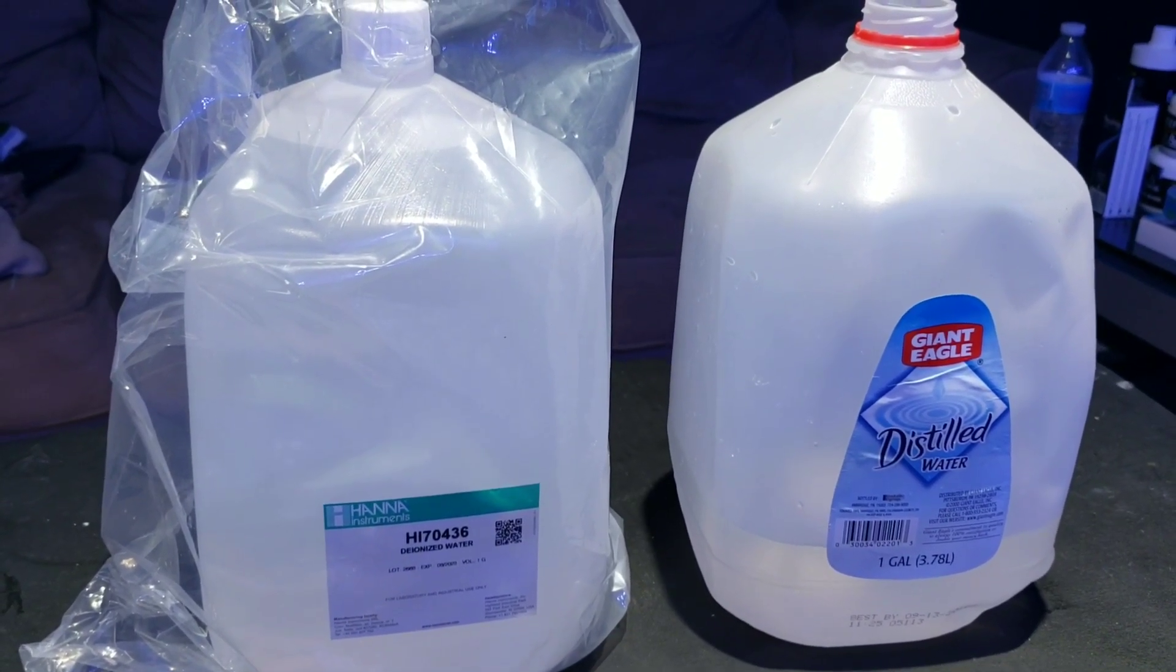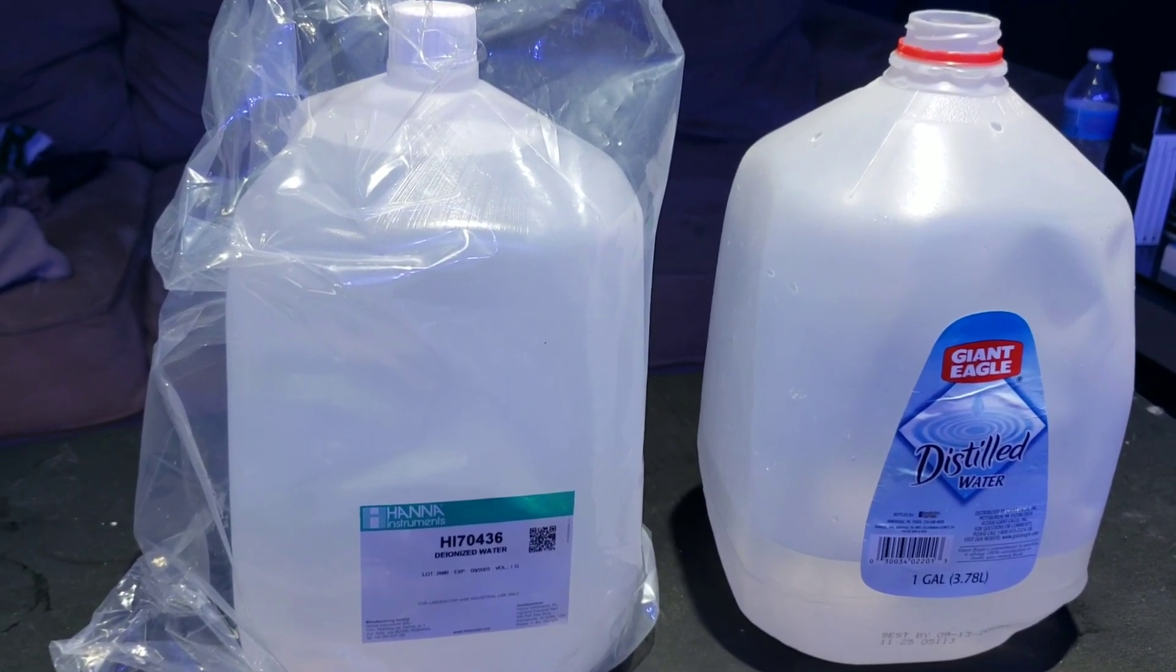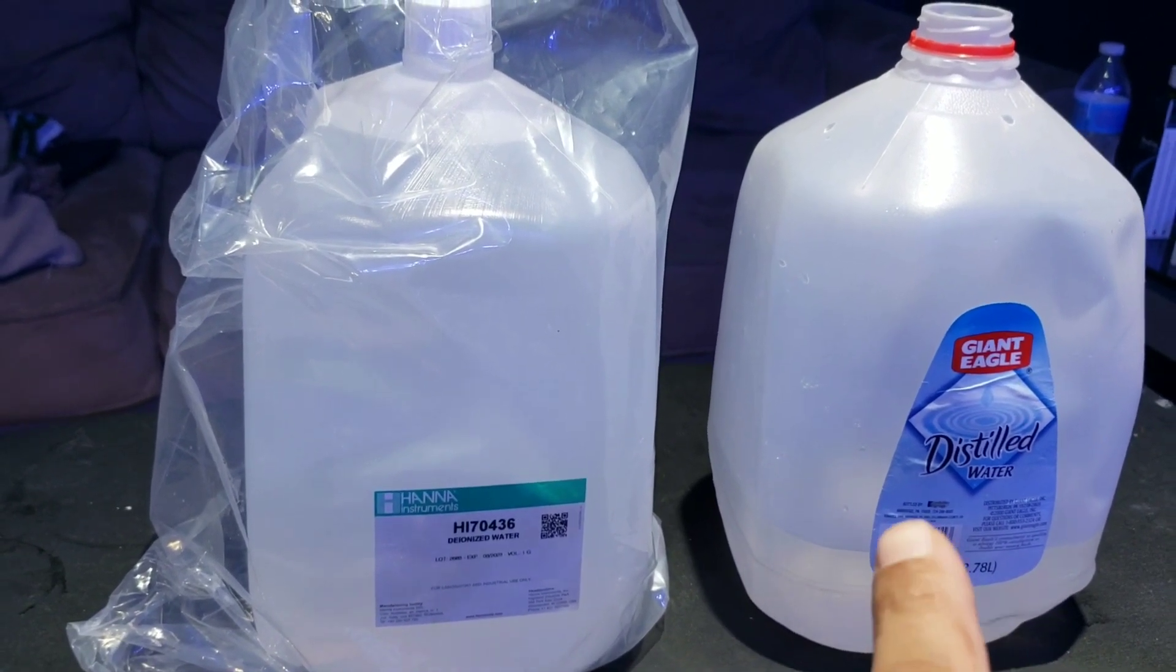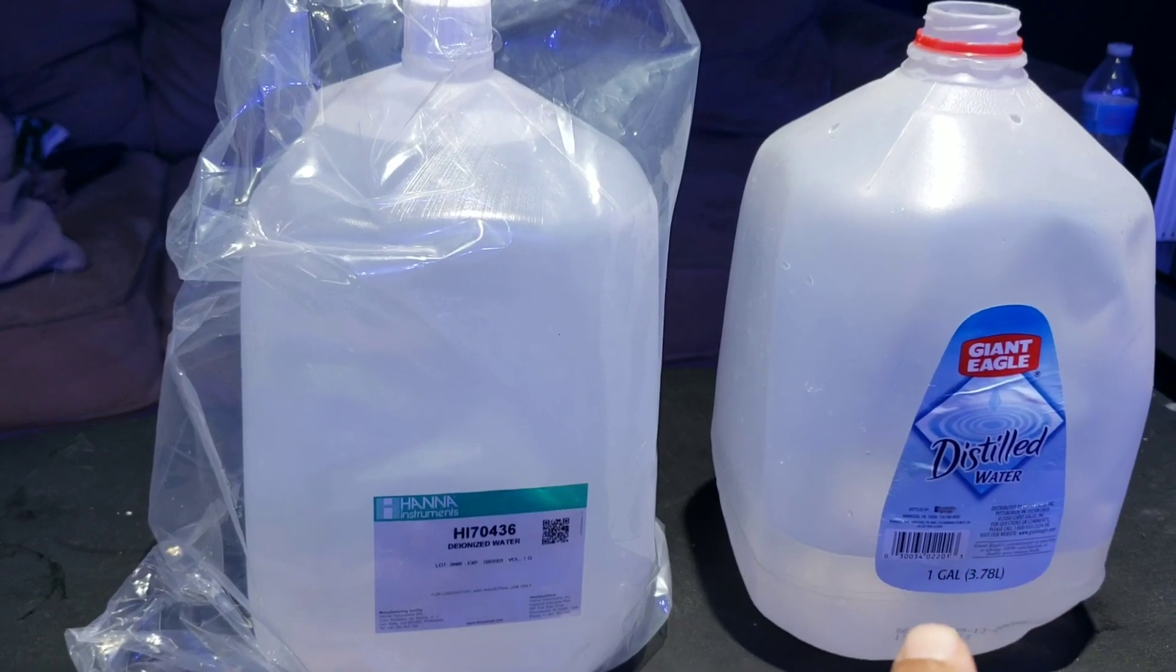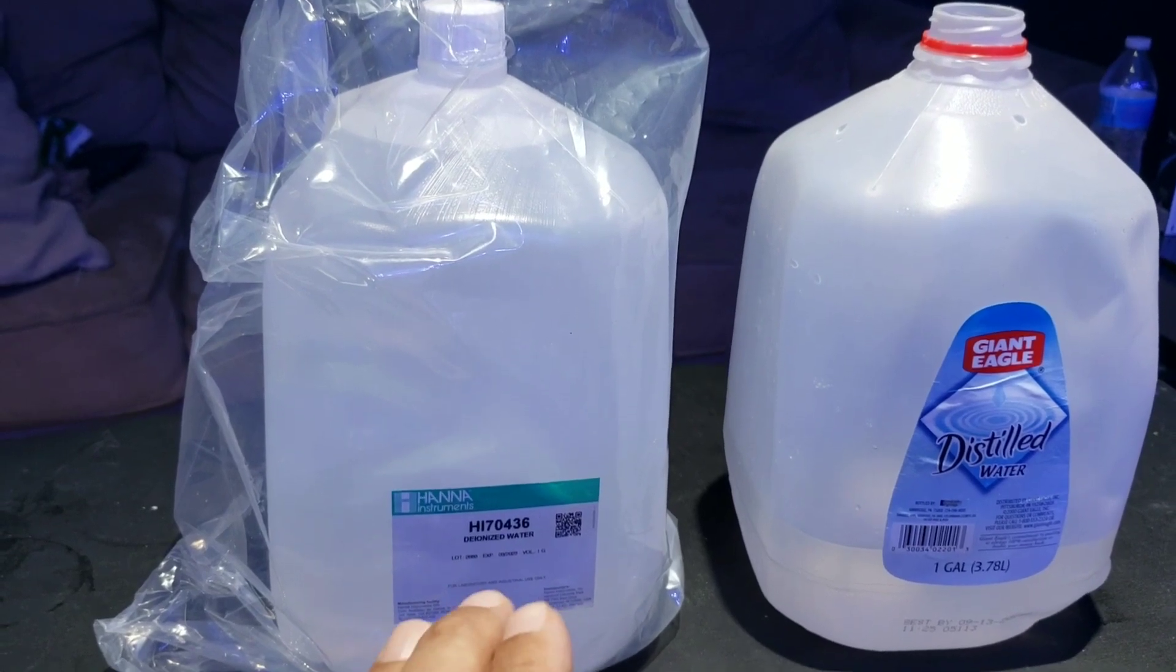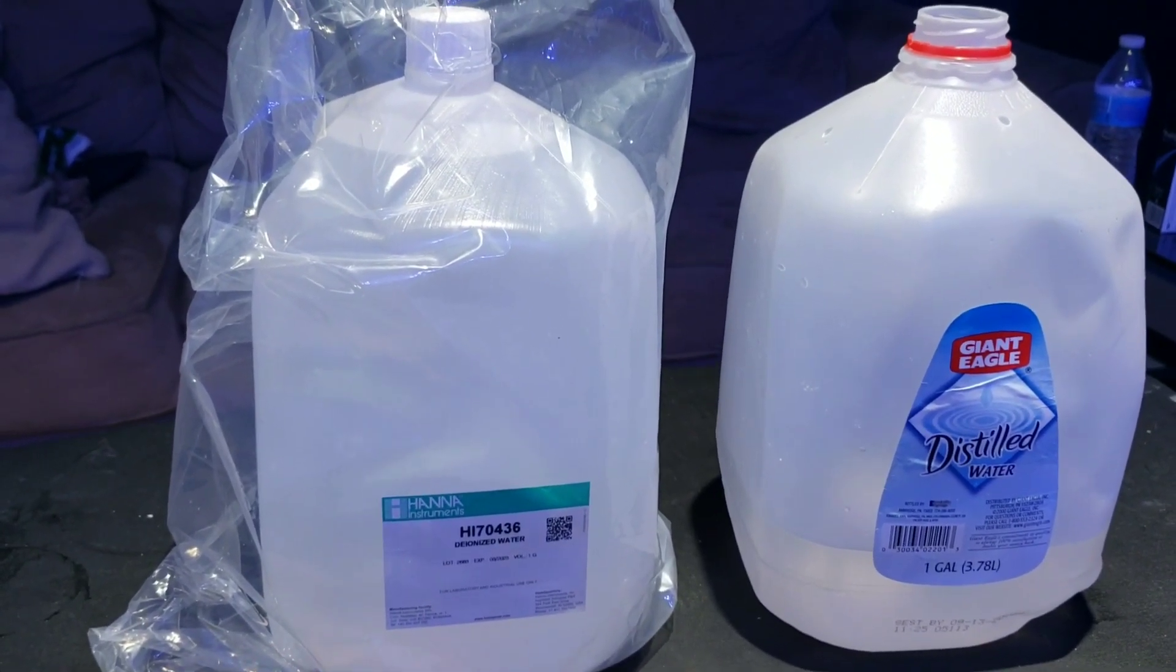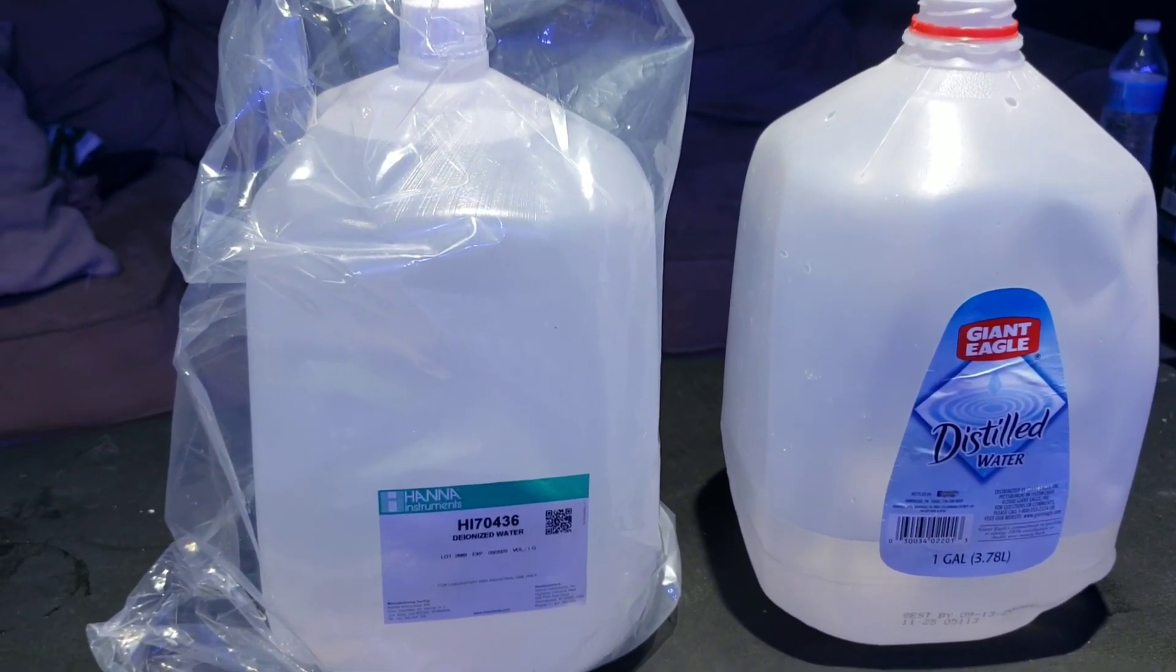Even if you wanted to use your own reverse osmosis, it's up to you. I prefer not to use mine just in case it's not reading right. I'll go to the store and actually pick up this instead. But I did get this just to tell you guys that you don't need this. If you want to, cool, buy it. If you don't, you don't have to. But I thought I would share that with you real quick before we move on with this video.